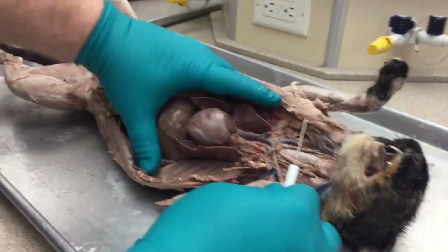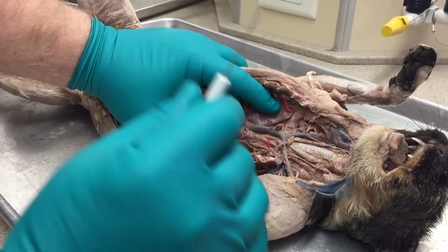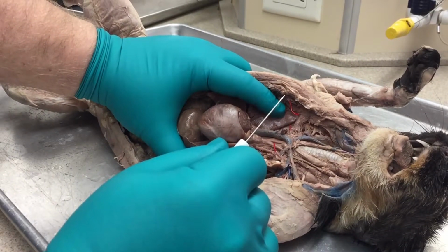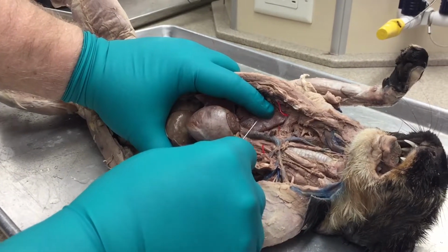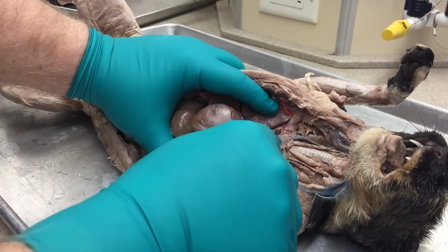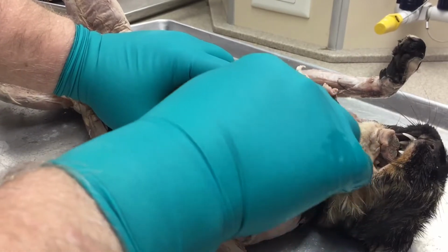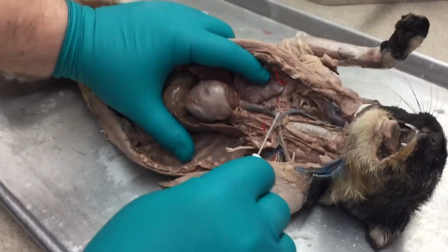Go through the arteries and veins of the cat. We'll start with the veins. Remember that veins always move back towards the heart. So we're going to start next to the heart, but they are not going to be moving out. If it's a vein such as the superior vena cava, which is right here, that is moving back to the heart, and it goes into the right atrium.